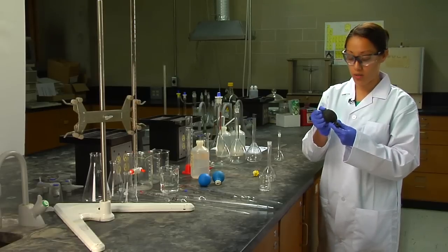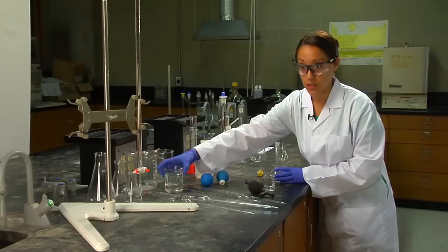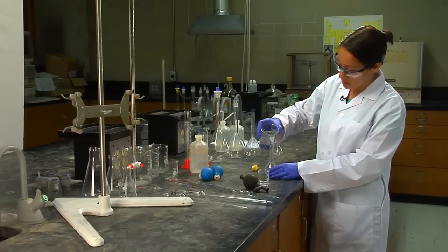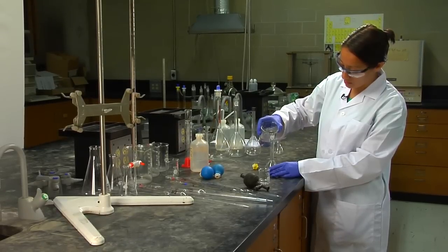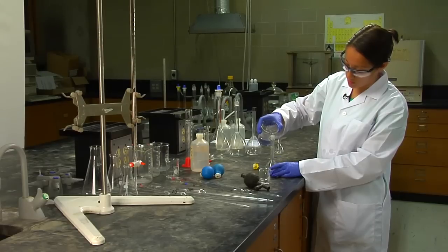Now that the hardest part of your standard solution preparation is finished, you just get to dilute it. Just have some distilled, deionized water. You're going to fill it up as much as possible until it reaches about the bottom of this neck.